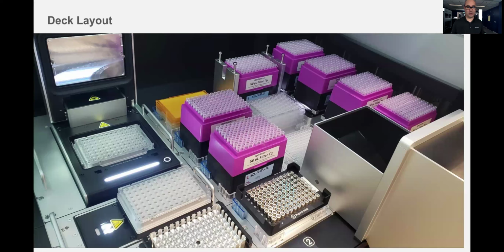So this was figured out slowly by all sorts of optimizations and testing to find out the best setup of the deck. If you remember the overall workflow, the first third of the protocol is the cDNA reverse transcription. Most of that is done with a P50. So if you see on the deck, as I use those P50s, 96 samples, 96 tips for each enzyme reaction, I would be dumping those tip racks into the trash chute, clearing up space so I could do the bead washes.